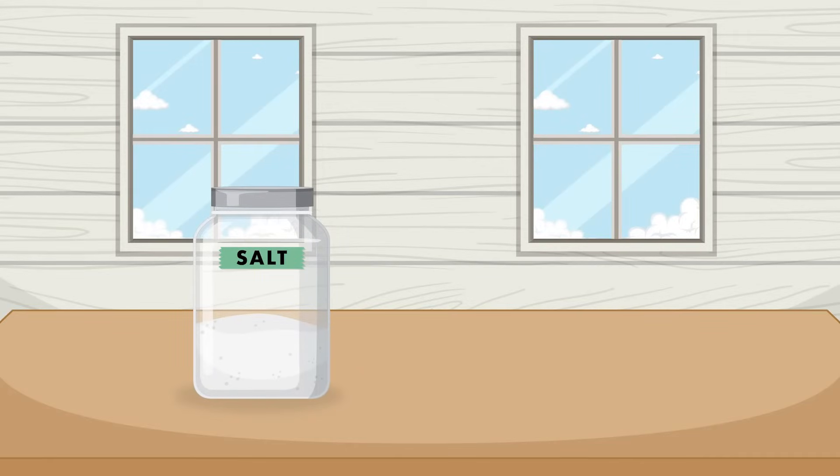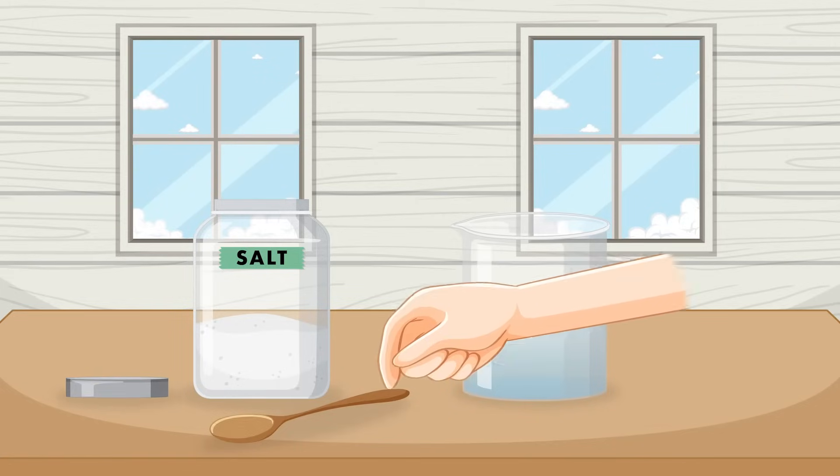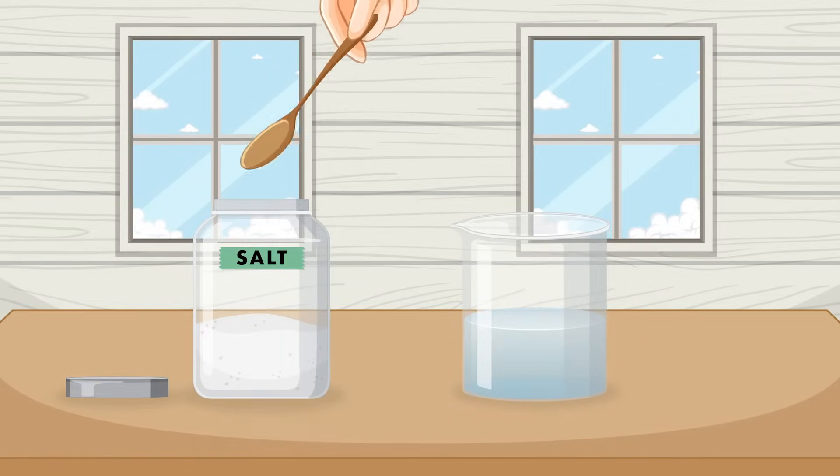Here we have some table salt, a teaspoon and a beaker of warm water. Let's add a teaspoonful of salt to the warm water and give it a stir.